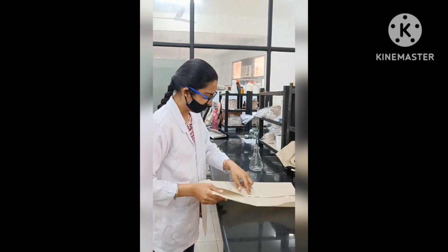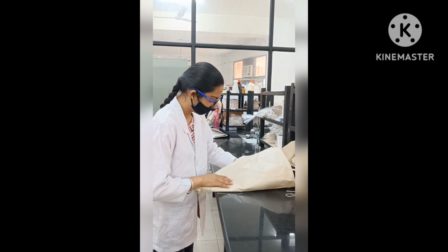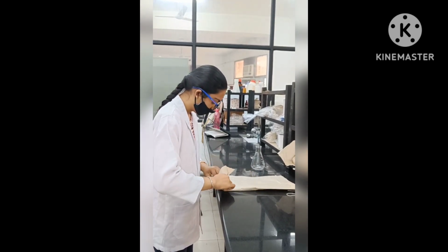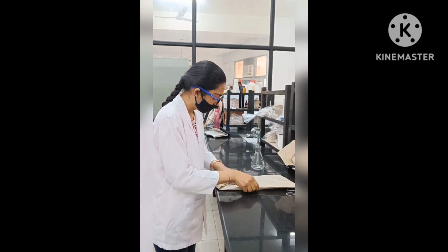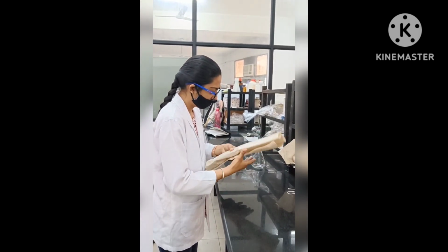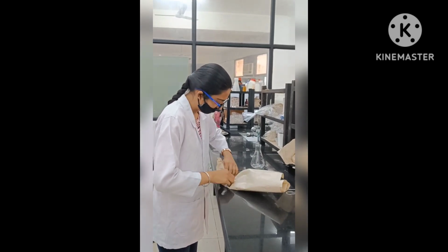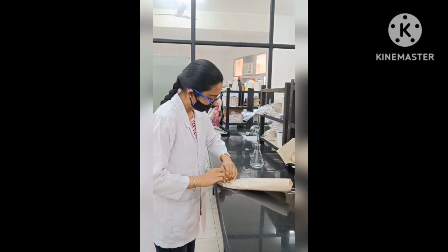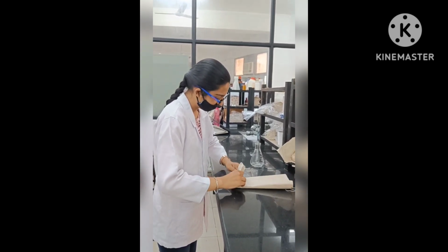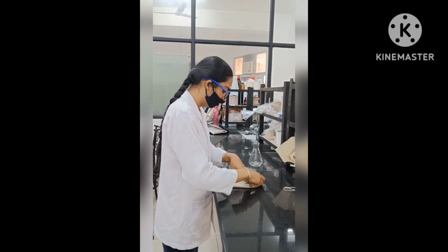The items are loaded on the shelves. Appropriate spacing should be maintained between the articles on the trays for efficient heat circulation. The door is closed by fastening the screws provided, after which the temperature begins to rise. It is better to have sound knowledge of the sterilizing holding time and temperature of the hot air oven. The thermometer is checked to determine whether the desired temperature is achieved after a certain holding time.